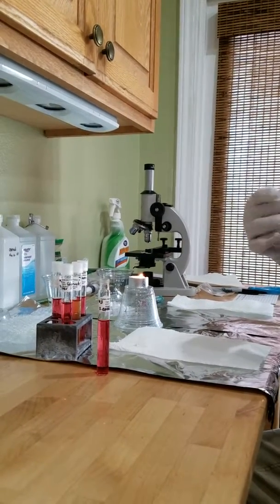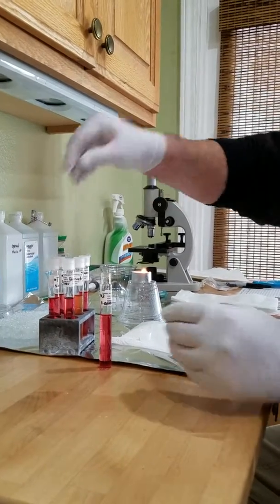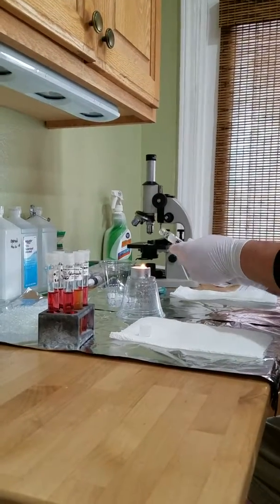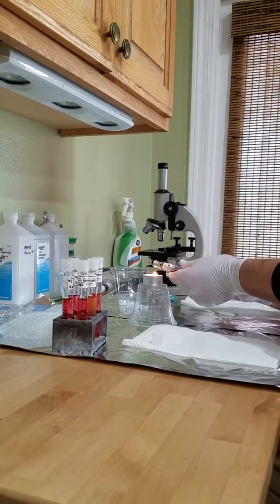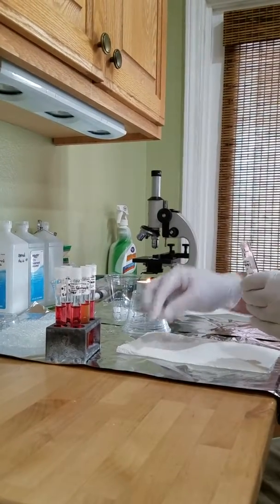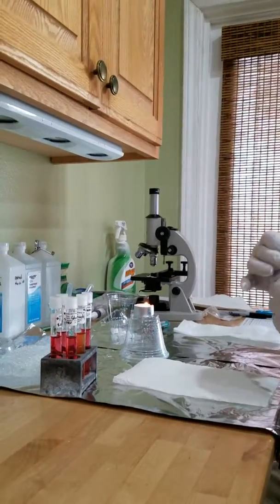Ensure they all got the same cap, same everything. Last but not least, my number 3 mannitol of the epidermidis. Its cap. Well, okay, we're going to go ahead and finish filming.